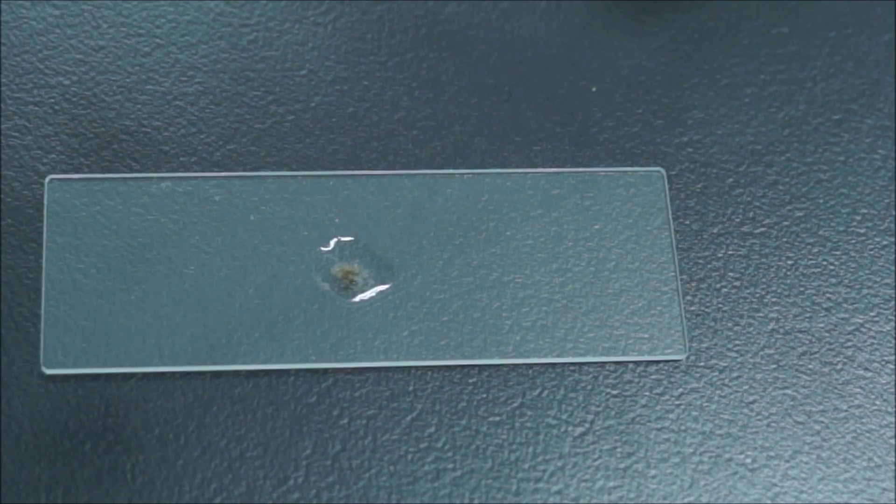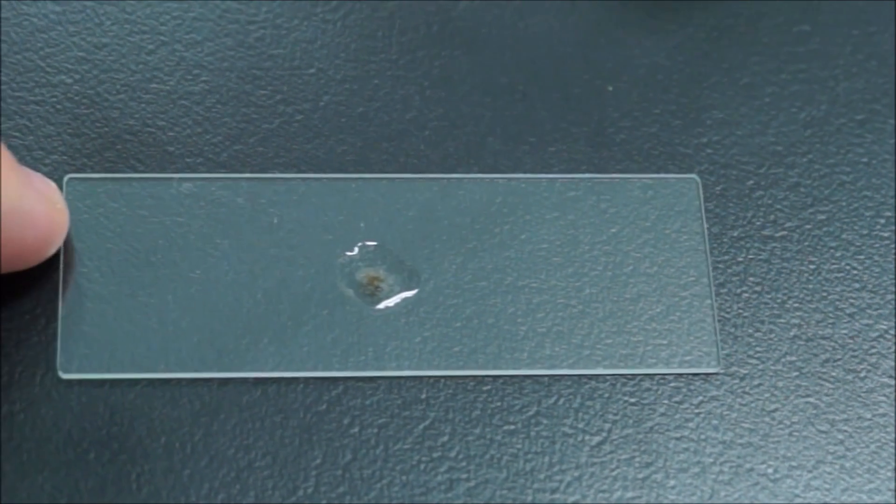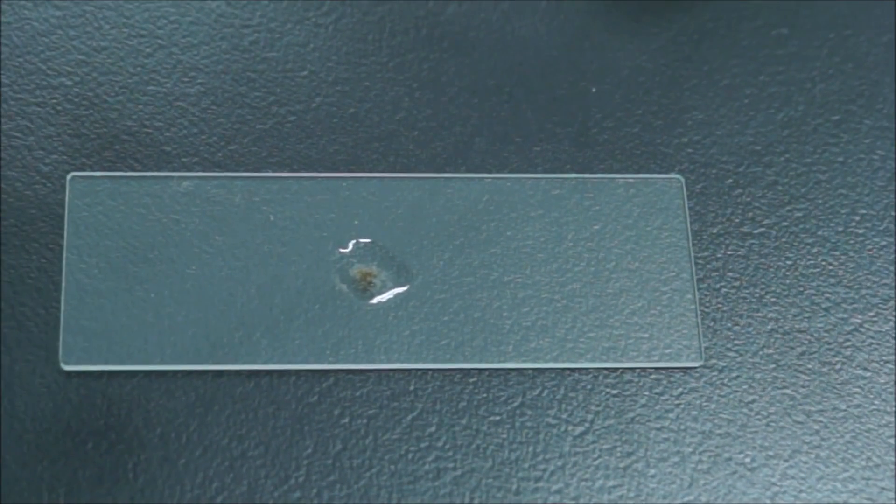So try and have a look at that under the microscope. You'll probably only need to use the 4x objective lens, maybe the 10x to get a good photo. So let's get started. Thank you.